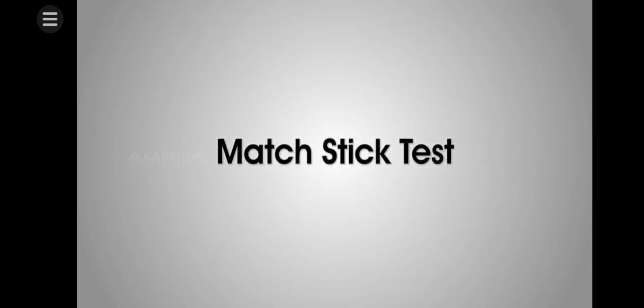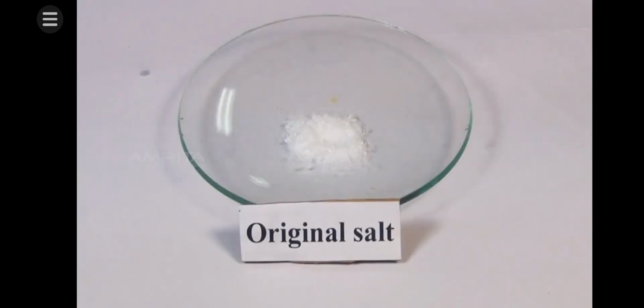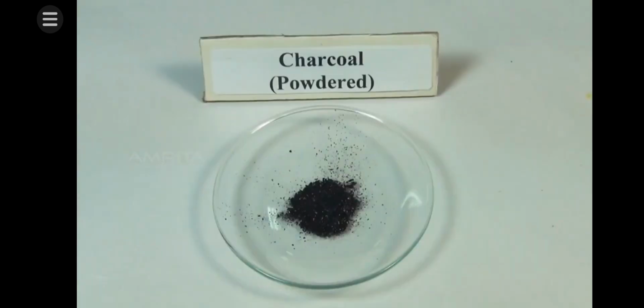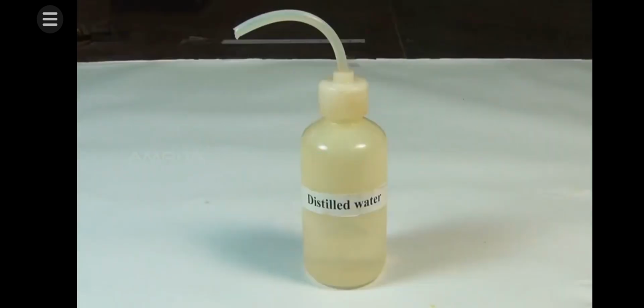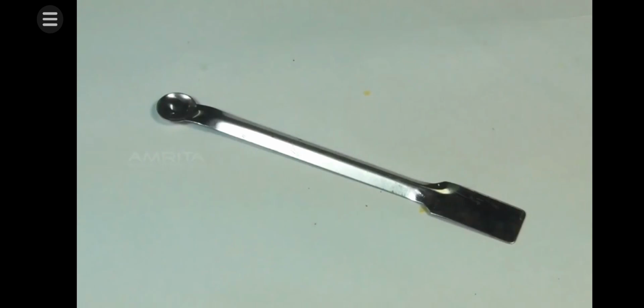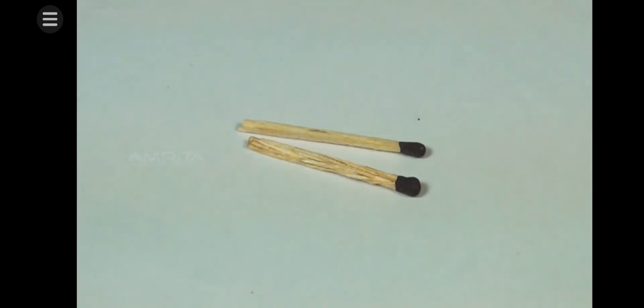Matchstick test. Materials required: original salt, solid sodium carbonate, powdered charcoal, distilled water, sodium nitroprusside solution, watch glass, spatula, glass rod, wooden splinter, china dish, and Bunsen burner.